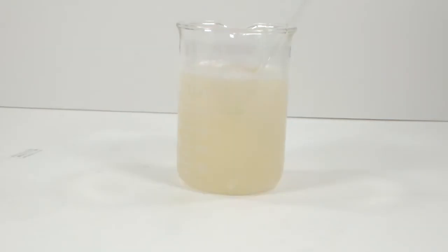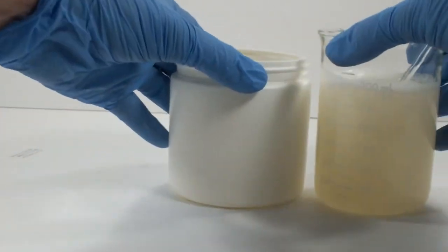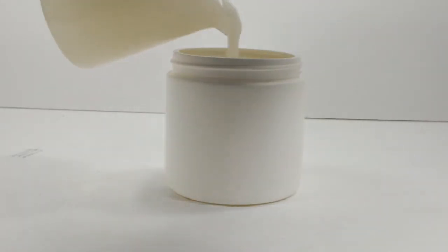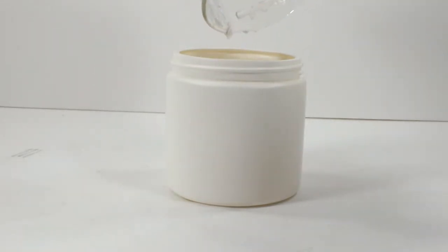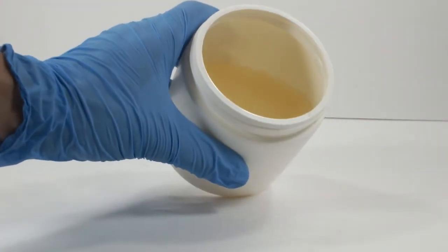I dumped this gelatinous goo into a 16 fluid ounce straight-sided jar. This is a plastic jar, and this product should not be stored in glass. It's a pretty strong base, and it will supposedly etch glass, especially soda lime glass, if left in contact for too long. I chose this jar mostly because it's short and wide, which should make it easier to get the product out for use. It's still a bit loose now, but it does set up into a gel over the next day or two.